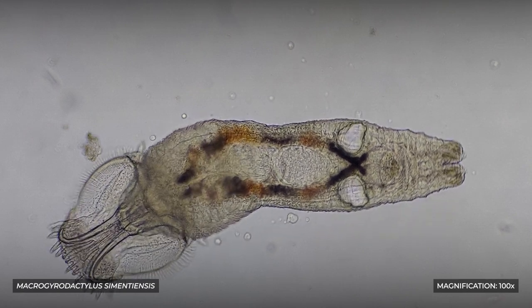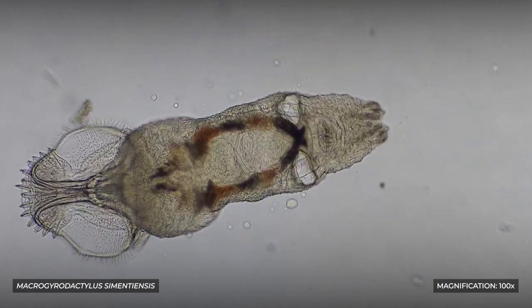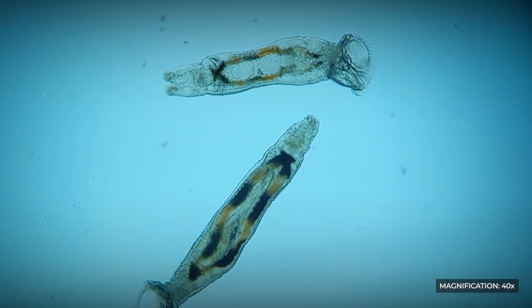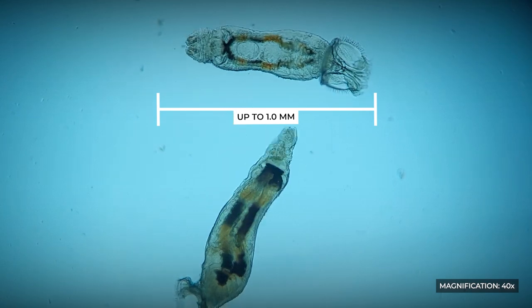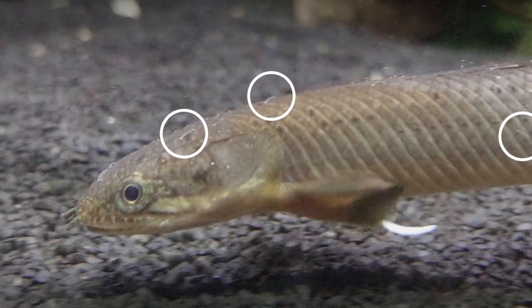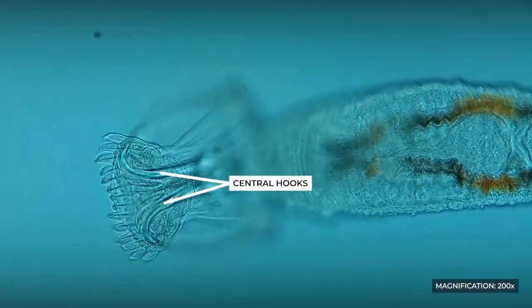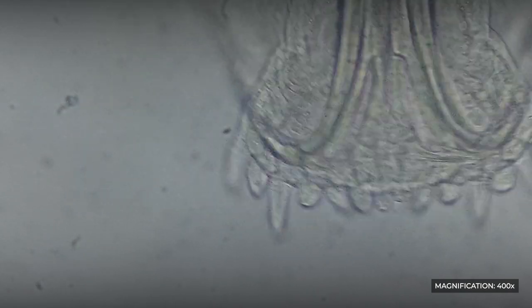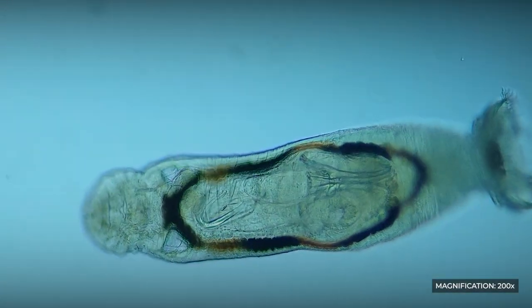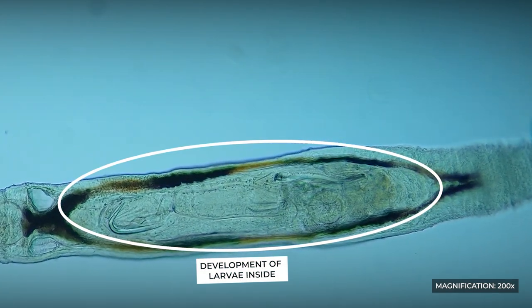Macrogyrodactylus is a representative of the genus Macrogyrodactylus that parasitizes on the body of Polypterus. It differs from the typical Gyrodactylus primarily in its size, reaching about 1 mm in length, which allows it to be seen even with the naked eye or using a magnifying glass. The attachment disc also contains two large hooks, but 14 small hooks are arranged on one side rather than in a circular pattern. Macrogyrodactylus are also viviparous parasites, with up to three generations of larvae developing within their bodies.